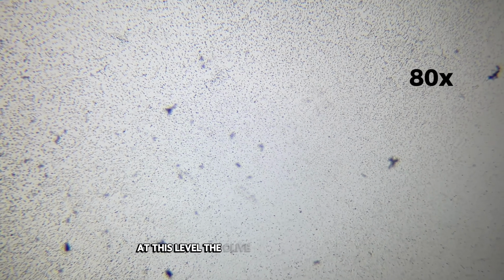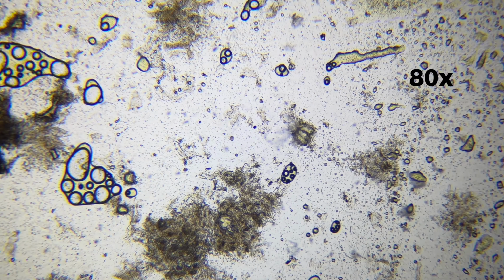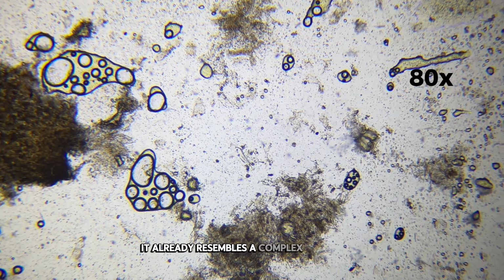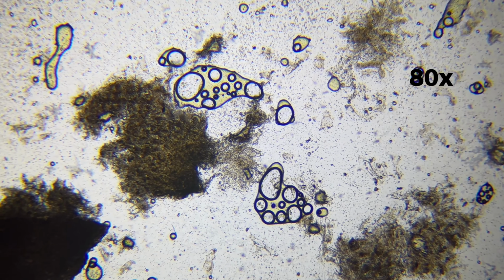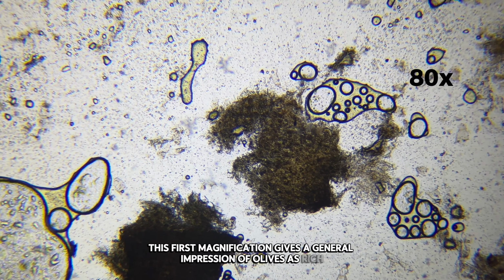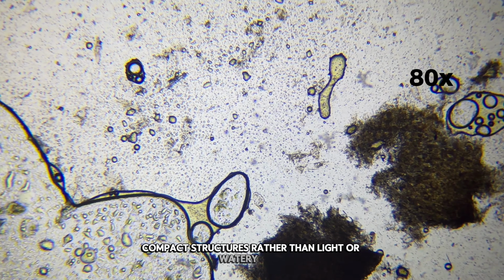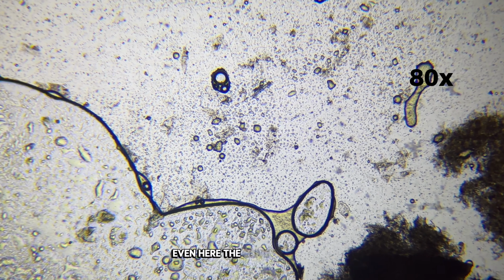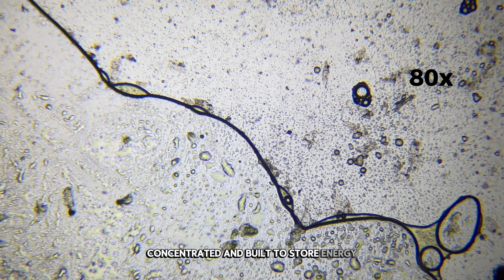At this level, the olive no longer feels like a clean, solid fruit. It already resembles a complex mixture of dense plant tissue and oily components. This first magnification gives a general impression of olives as rich, compact structures rather than light or watery ones. Even here, the olive feels heavy, concentrated, and built to store energy.